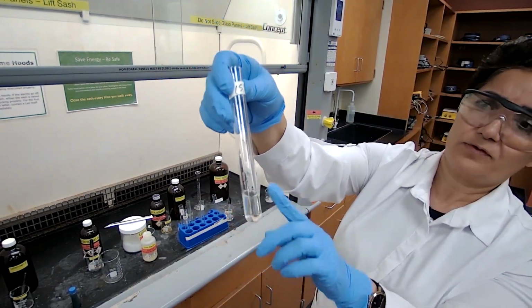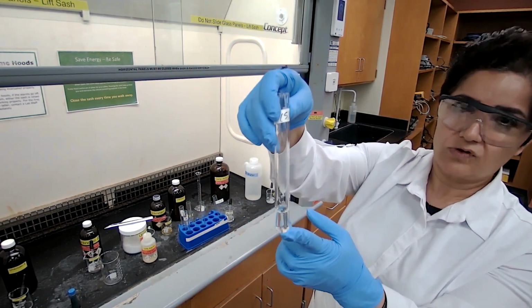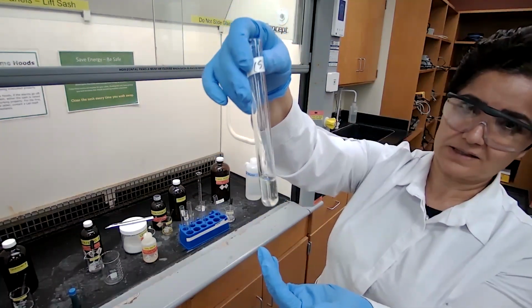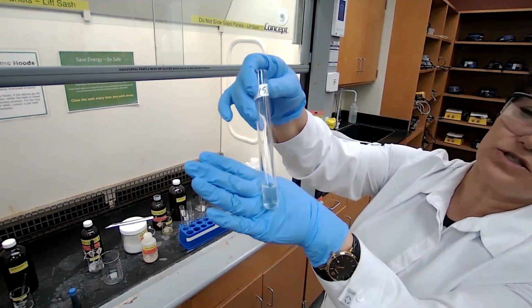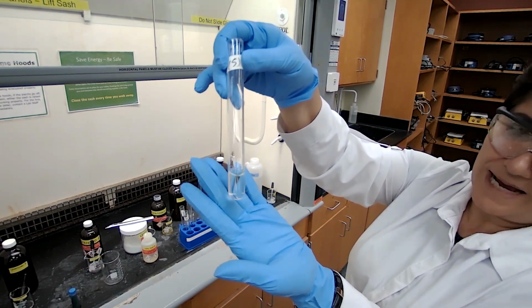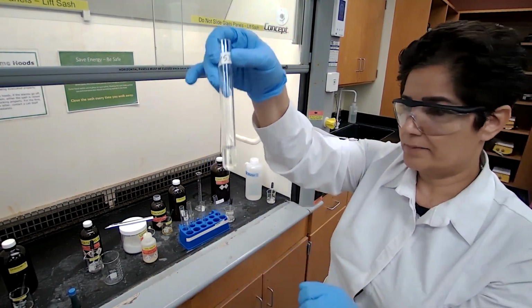It did dissolve. Before I discard, I checked again, it did dissolve. So unknown 5 also dissolved in sulfuric acid. Color change is a reaction. Disappearance of the solid compound that we had is also an indication that this compound is soluble in concentrated sulfuric acid. There is a color change, but the color change is like a tannish or yellowish color. It's very hard to see it through the camera, and I hope you could see it, but there is no solid left, so it is soluble in the sulfuric acid.